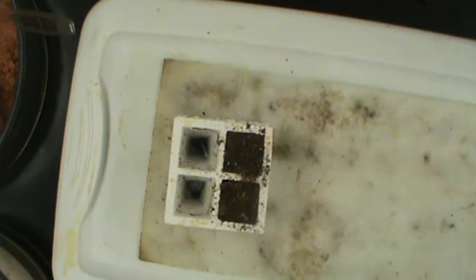We will then take this entire setup and put it under a light box that will supply a constant amount of light to our developing plants. That way, we standardize the amount of water and the amount of light that the plants are getting, and we can test the variables of different types of soils, different types of nutrients, different amounts of nutrients, whatever your group chooses to test, and how that will affect plant growth.